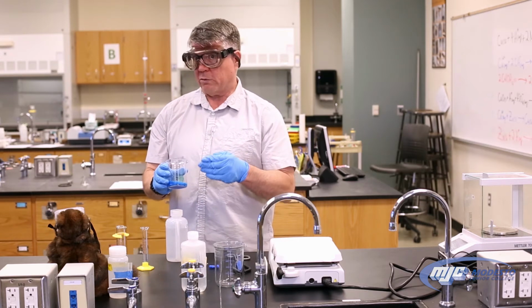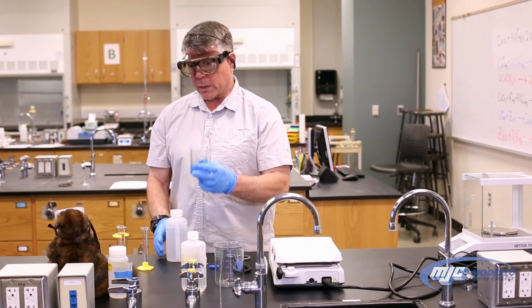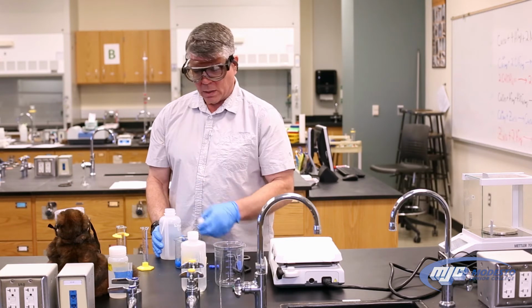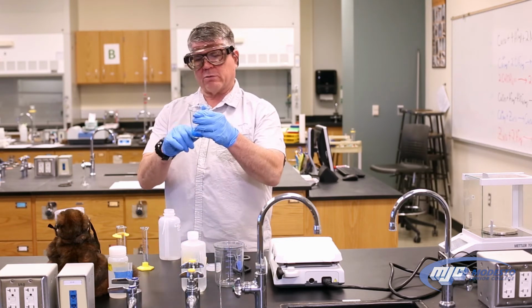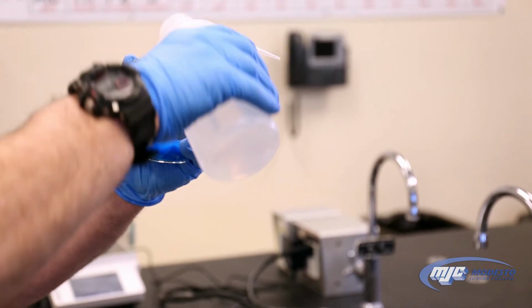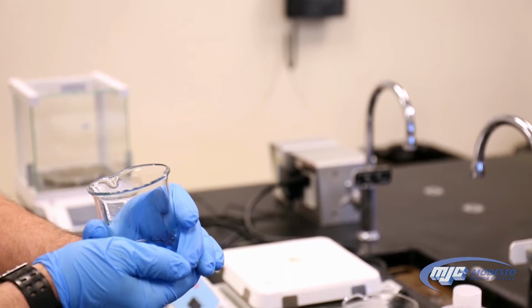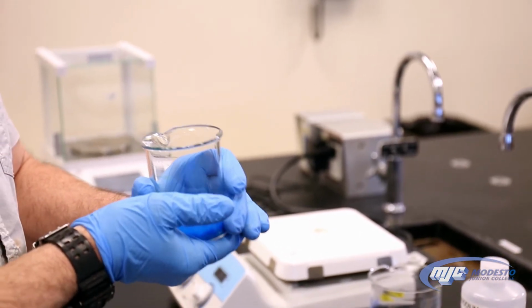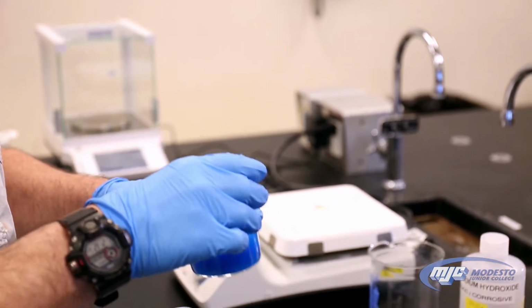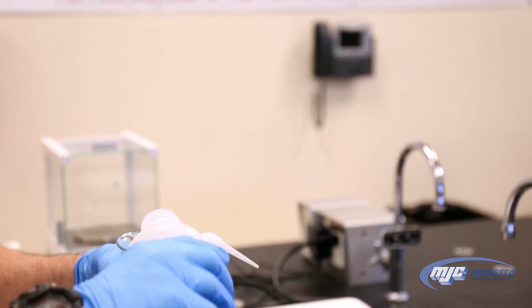Okay, that's that reaction. The next reaction is to heat this up and convert this to copper 2 oxide, but there's not enough liquid in here. We need to add some more. So we're going to add about 50 mLs of DI water. I don't really measure this carefully. I use the marks on here. Bring it up. There's already some in there, so I'll bring it up past 50. One of the observations that would be useful is that when you feel this, it's warm. So, yeah, some DI water.